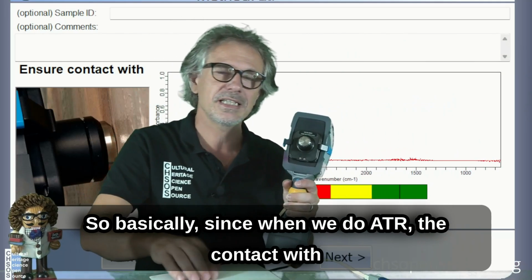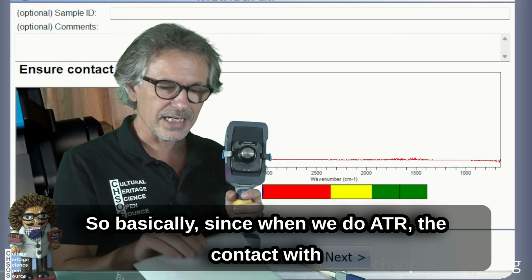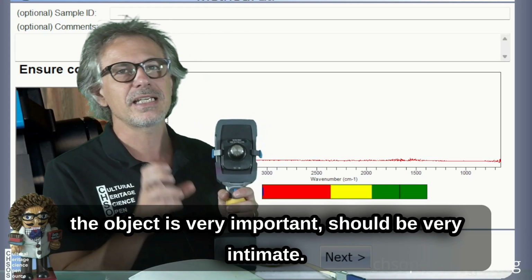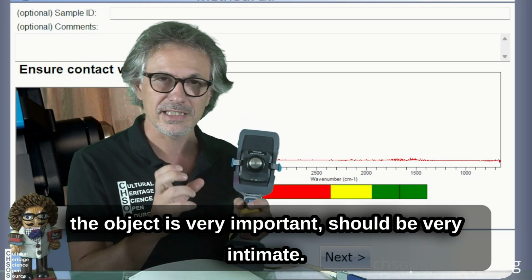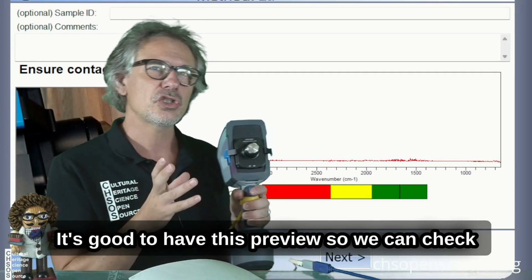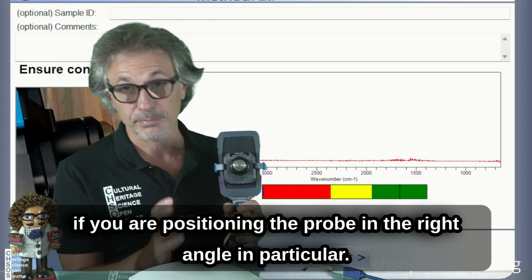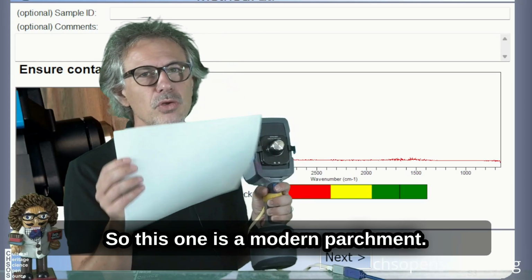Since when we do ATR the contact with the object is very important, it should be very intimate, it's good to have this preview so we can check if we are positioning the probe right, the angle in particular. So this one is a modern parchment.